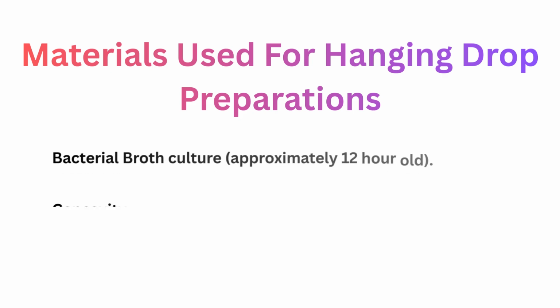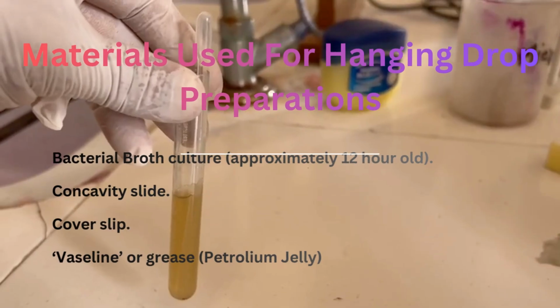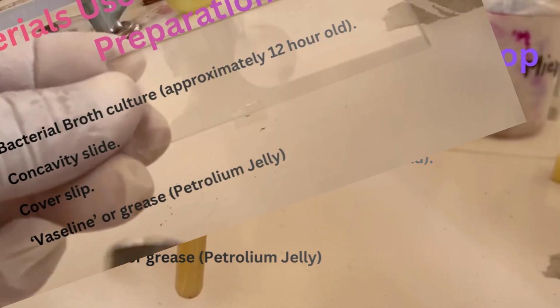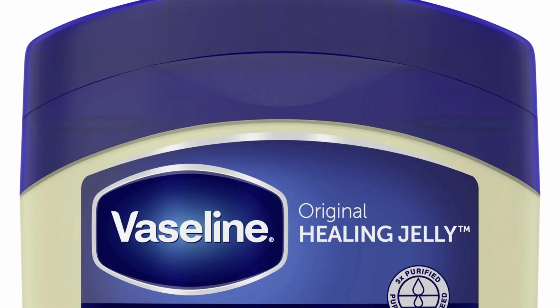Now let's discuss the materials required for performing the hanging drop preparation. Most commonly required materials are: firstly, bacterial broth culture approximately 12 hours old; secondly, the concavity slide; thirdly, cover slip; fourthly, Vaseline or grease, petroleum jelly; and last but not least, a microscope.